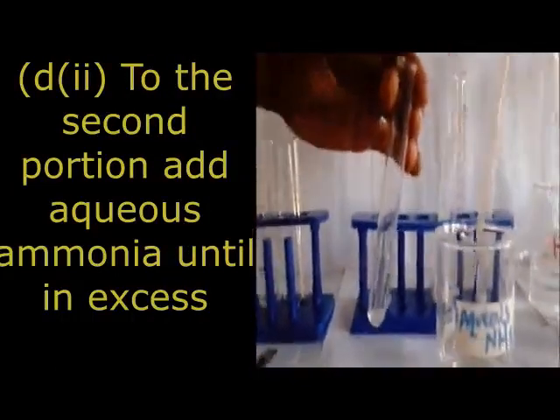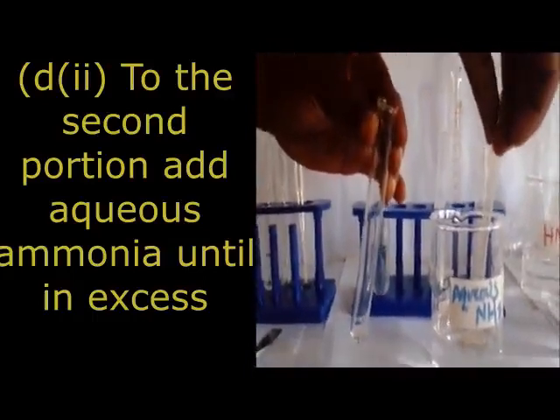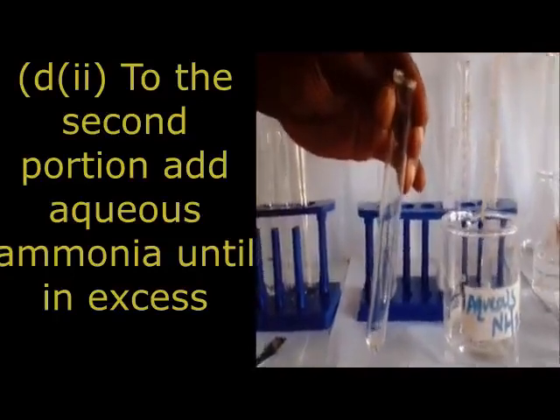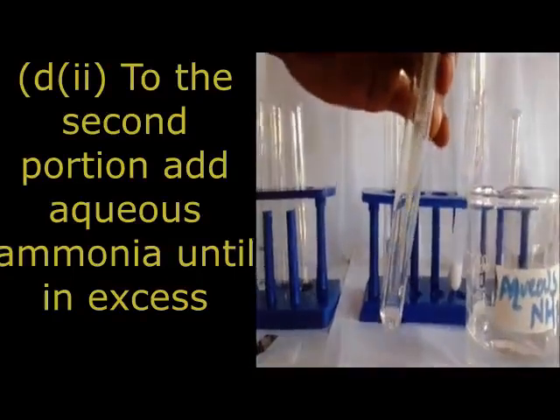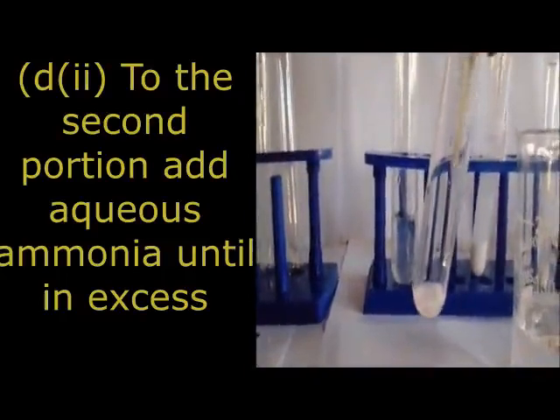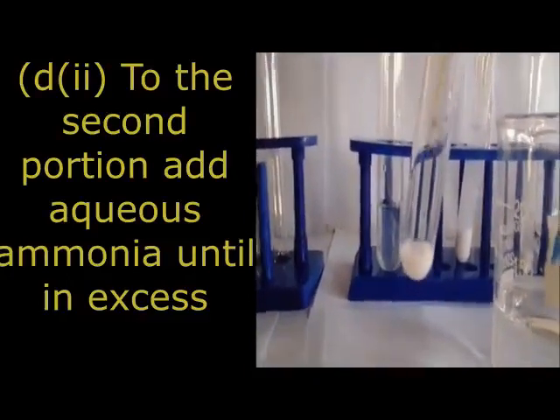Now the second test, the second portion, we are adding aqueous ammonia. So we get our reagent from the reagent bottle of ammonia, then we transfer a drop here.